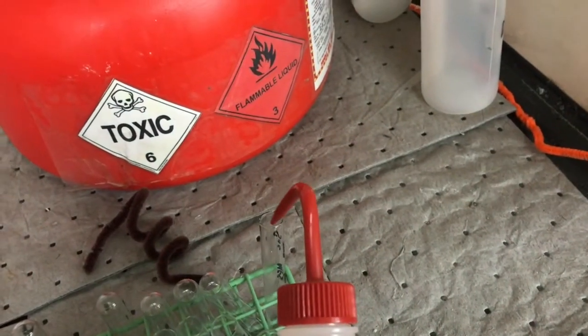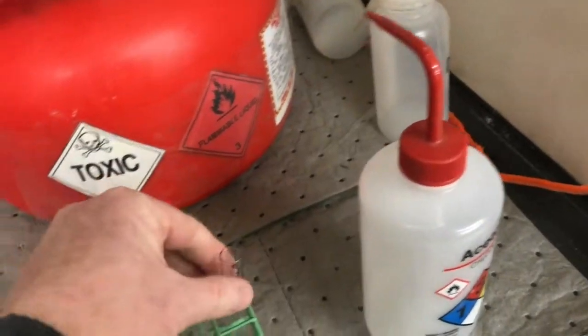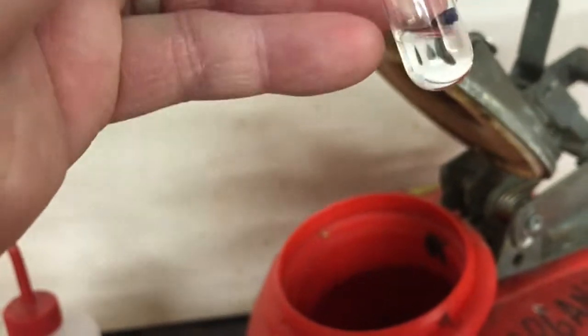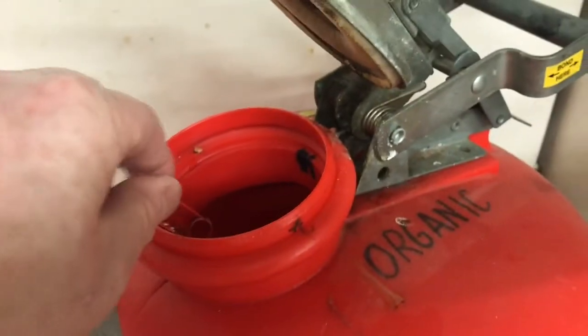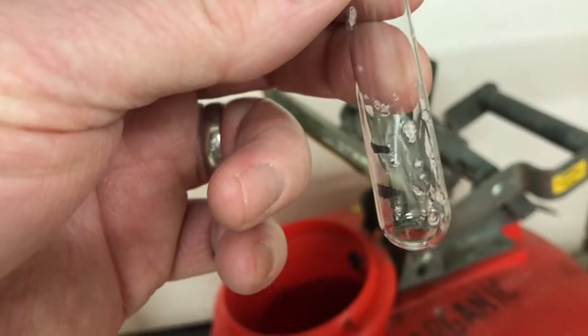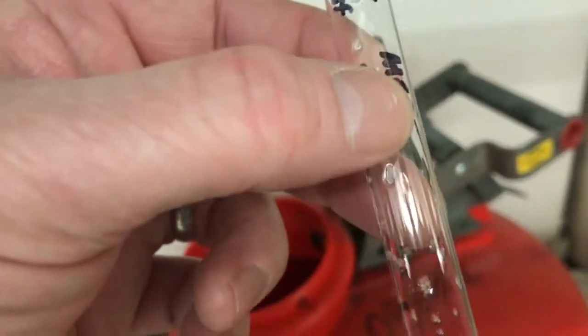I want to show you what else I do. I can add a little acetone to that. Acetone is a great solvent for dissolving anything, so that could dissolve it quicker. Try to get all that solid out. Now there's still a little bit in there, but I know I got most of my hexanes out. I have acetone in there.